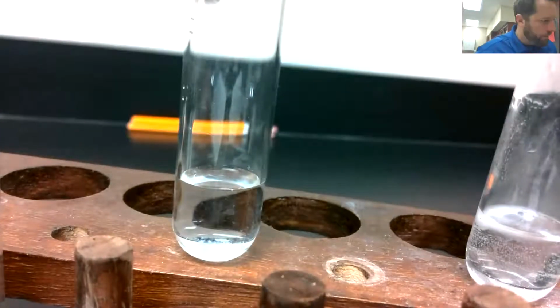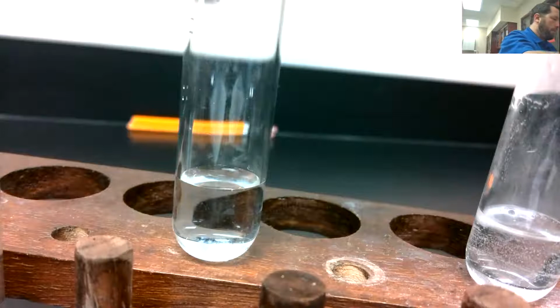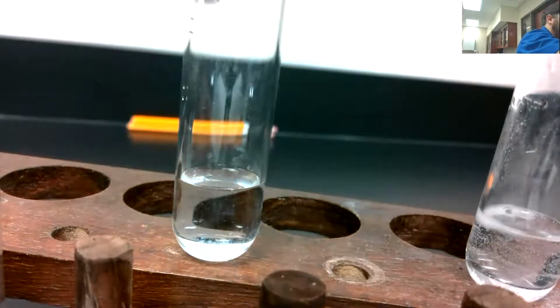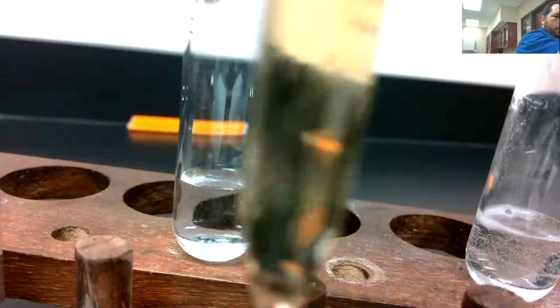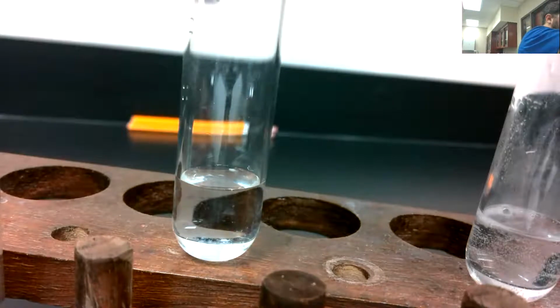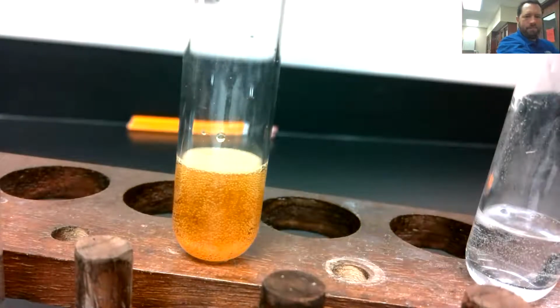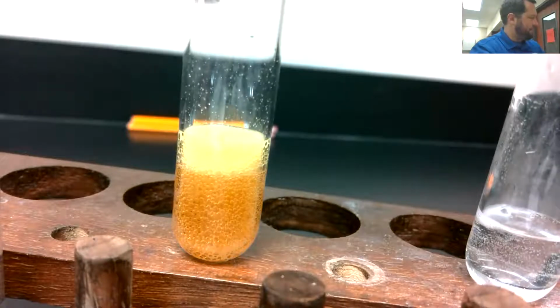So we are looking here at our hydrogen peroxide, a clear liquid. Don't drink it, it'll make you sick. Looks like water, but don't drink it, it'll make you sick. And now I'm going to add my catalyst. So catalyst just kind of speeds up a reaction. Now the catalyst has a yellow color to it. So don't think we're going to have a color change. We shouldn't. The catalyst just has a yellow color to it. Aha. Look at that.